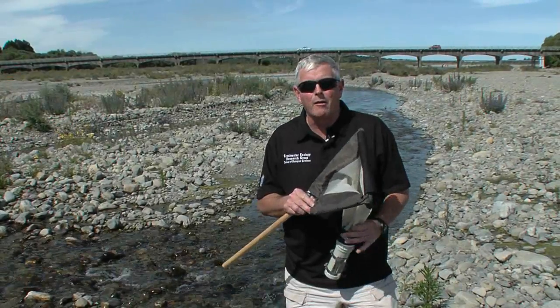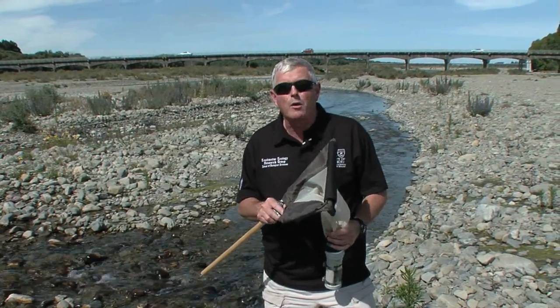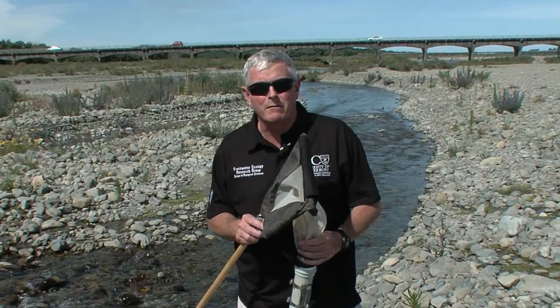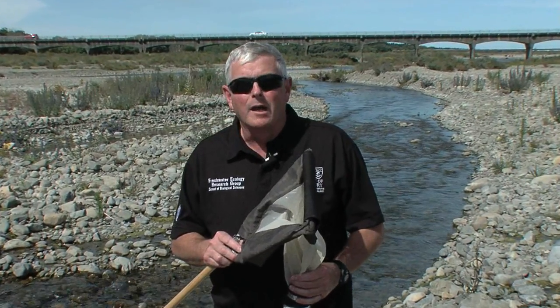What I'm going to show you now is how to take qualitative benthic macroinvertebrate samples. When we're talking about benthic macroinvertebrates, we're talking about small insects and invertebrates that are living on the bed of the stream or river. Macroinvertebrates are those that are larger than half a millimetre in size.